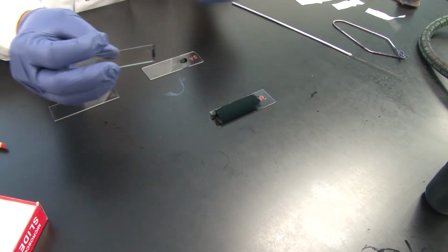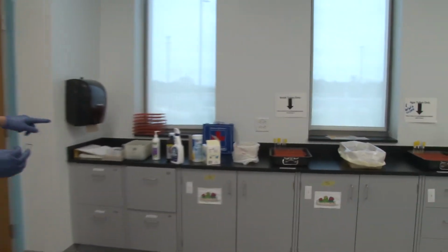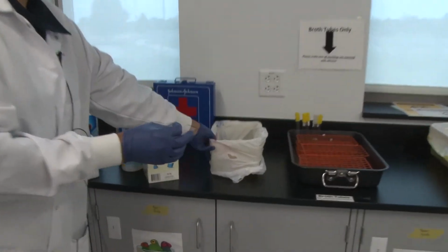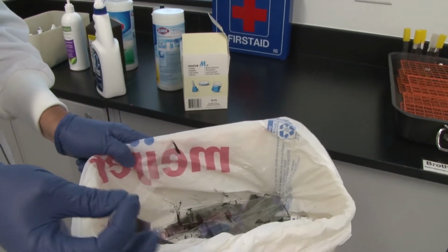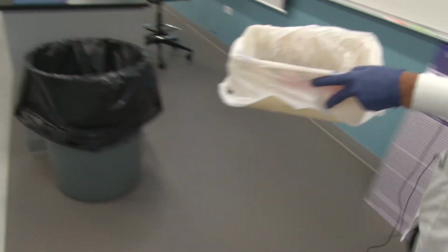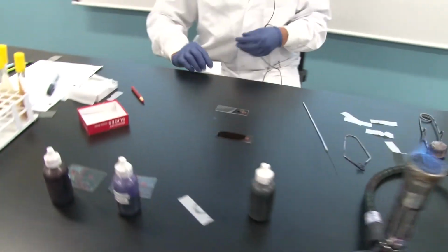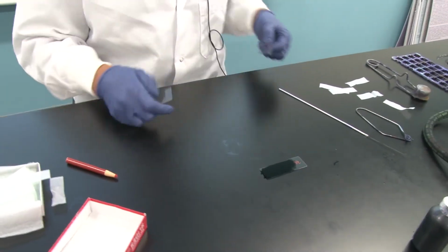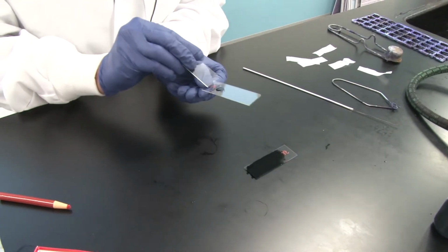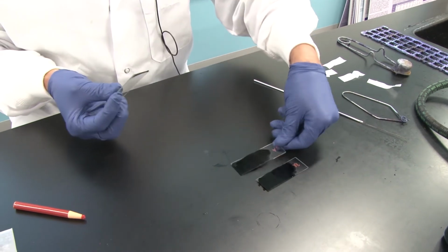So what I'm going to do is walk this slide over to our slide disposal. In fact, I'll pick this up and bring it back to the bench with me, but whenever you have contaminated slides or you're done viewing your stained slides, you simply dump them in this container. So we'll put this over here to keep it handy, and let's go ahead and make the smear on Staph aureus. Now on the first one I pulled it, but you are also welcome to push it like you would a blood slide. And that's it.